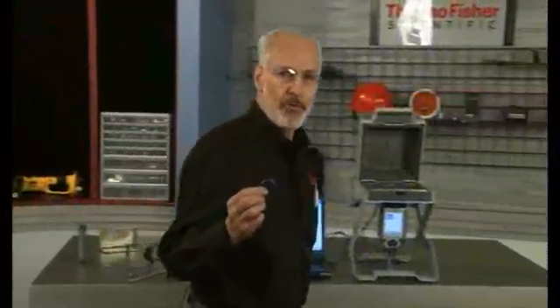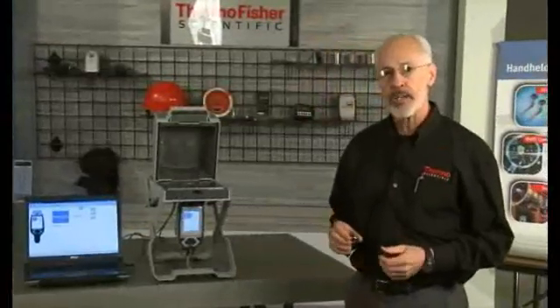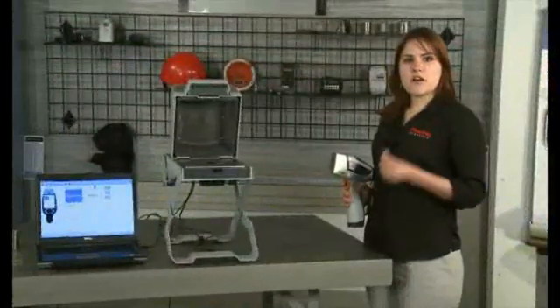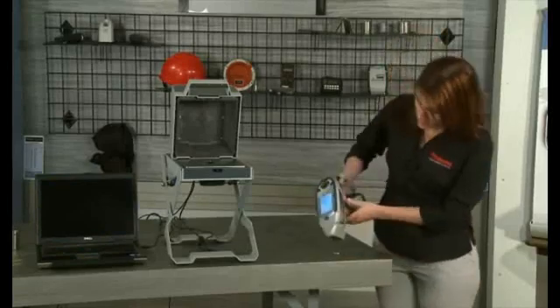Let's begin with a niobium stabilized version of stainless steel 304, called stainless steel 347, an austenitic stainless also known as chrome nickel stainless steel. We'll test it as though it is an unknown sample, but later we'll compare the measured results to the certified values. This will help to demonstrate that your handheld Niton analyzer truly does provide you with lab quality accuracy for alloys. We place the analyzer measurement window on the alloy sample and then pull and hold the trigger for typically about 5 seconds.